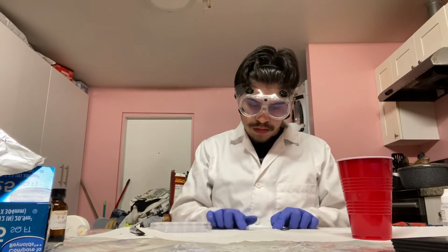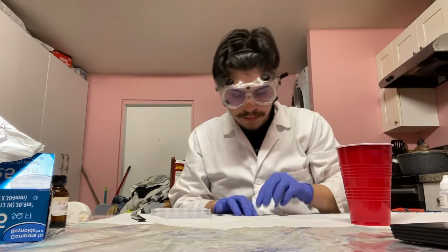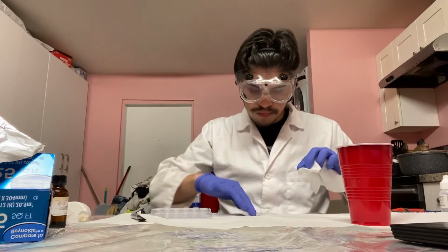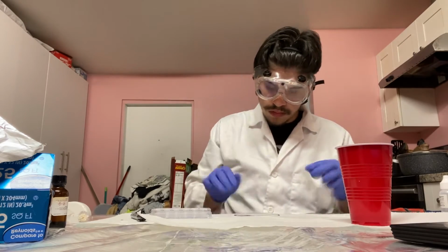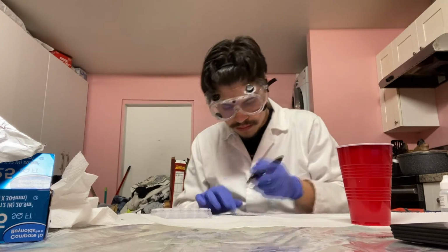With a permanent marker, separate 4 different compounds on the aluminum foil. Those compounds are AgNO3, CuSO4, CaCl2, PbNO3. Starting with AgNO3, grab the pipette, cut the tip, and place 2 drops of AgNO3 into its designated spot on the aluminum foil.